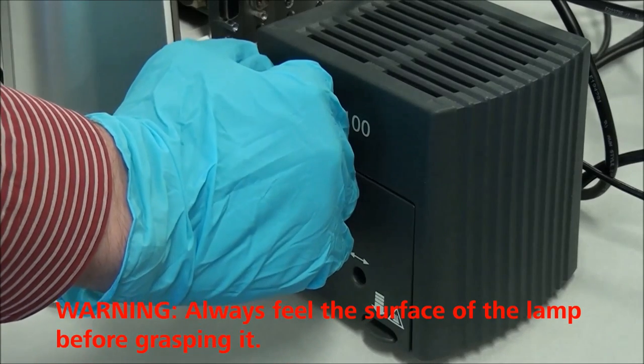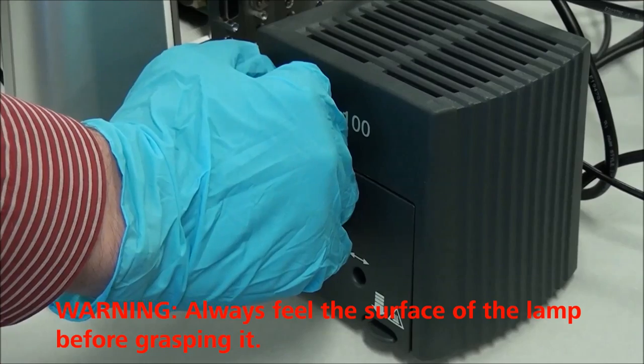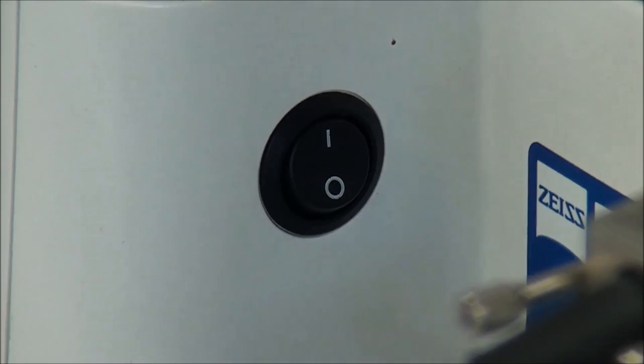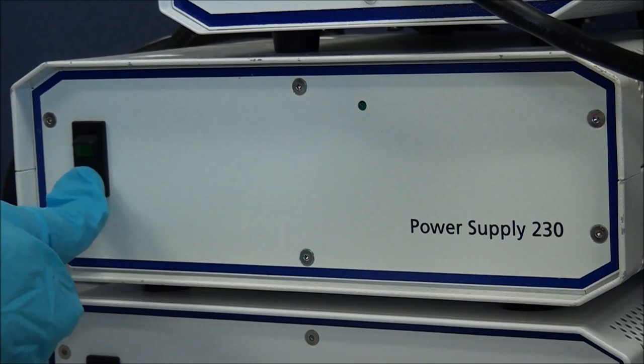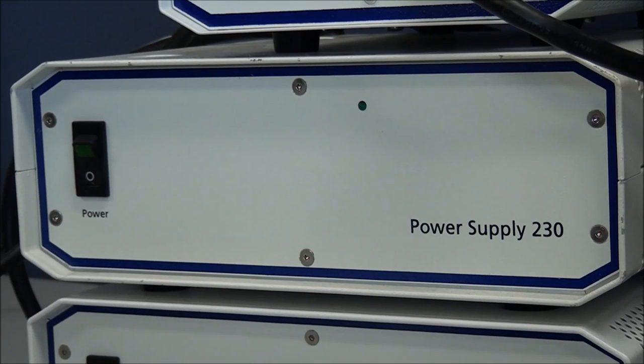Always feel the surface of the lamp housing before grasping it, as it may be hot. Turn off the HAL by turning off the microscope or the attached power supply. Wait at least 15 minutes for the lamp to cool down.